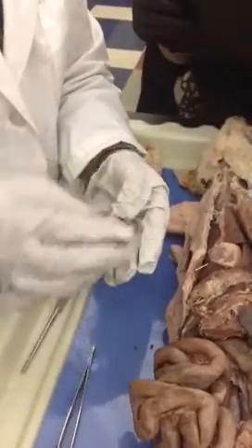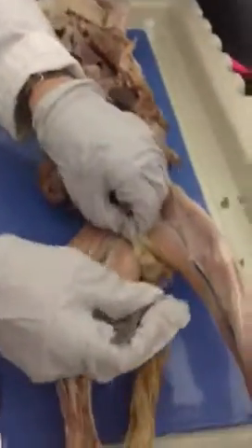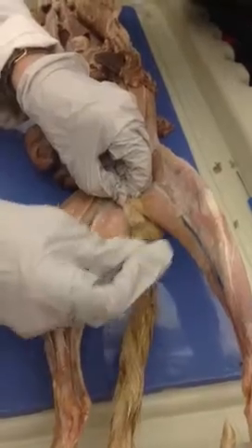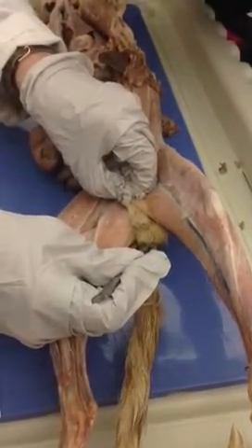All right, for reproductive parts, the fur down closer to the tail, that's the scrotum. Did you take that fur off? Did you cut it? Oh.